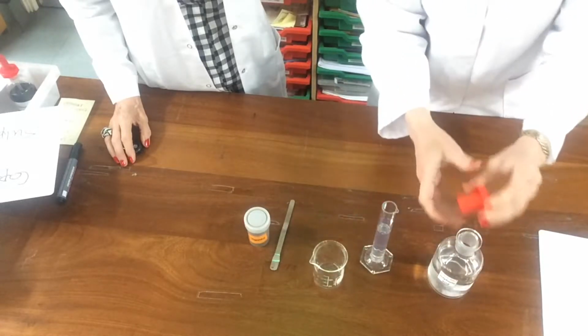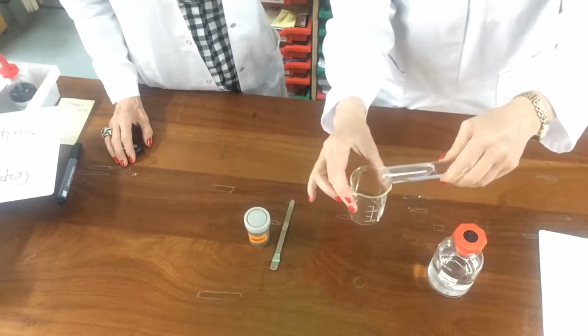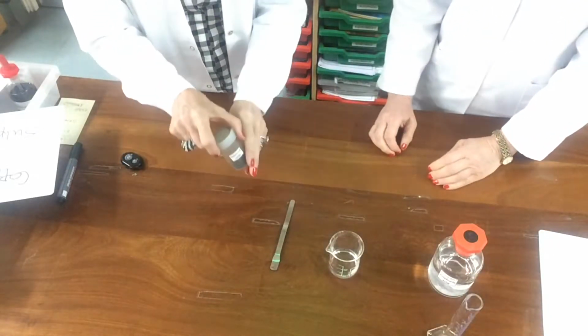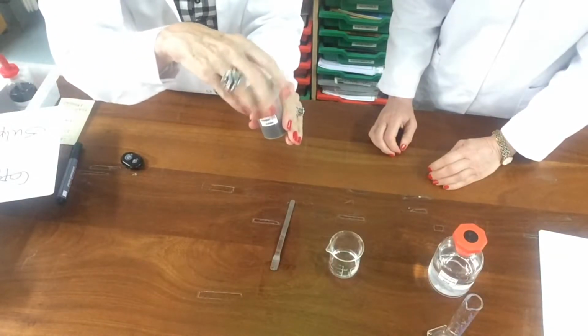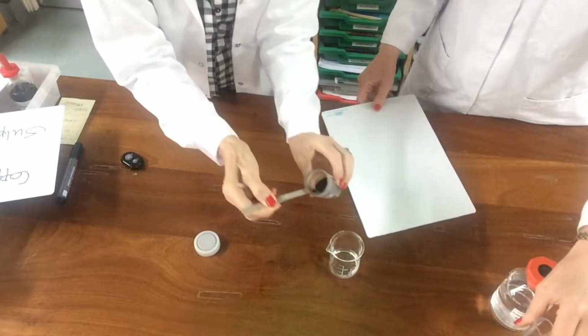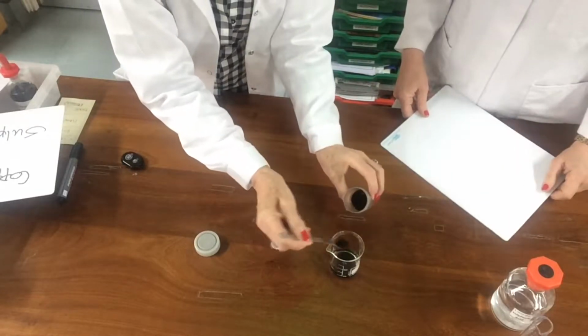and then put that into a beaker. So I've got a beaker here, put my 25 centimetres into the beaker, and Miss McLaren is going to add the copper 2 oxide. Copper 2 oxide. Now notice it's a black solid. So I'm going to add 2 or 3 spatulafuls of the copper 2 oxide into the sulfuric acid.